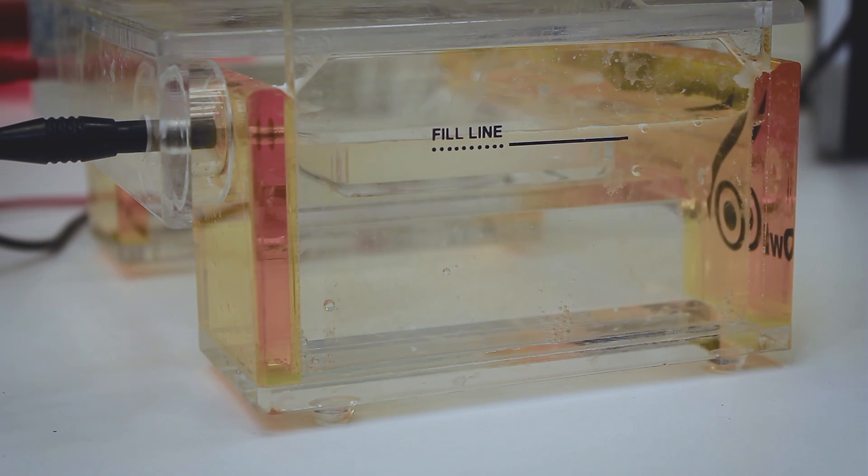You will know that your gel is running successfully when you see tiny bubbles rising from the bottom.